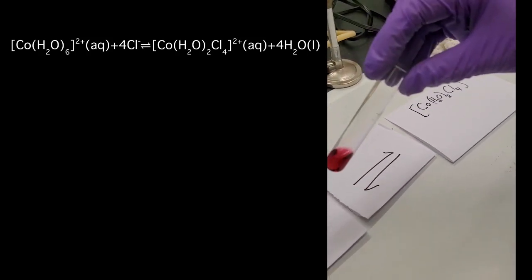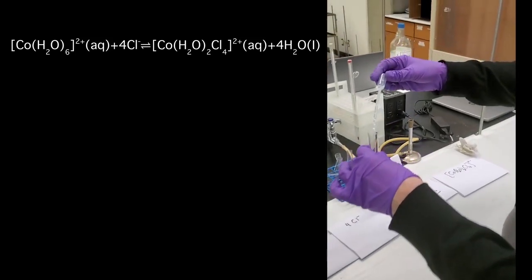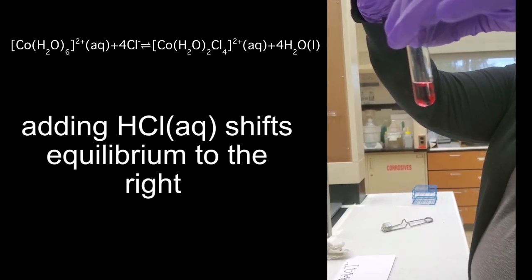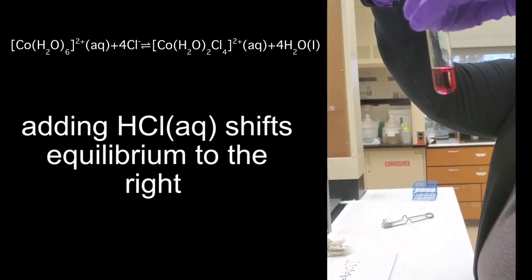The first thing I'm going to do is add extra chloride. Le Chatelier's Principle says if I add enough chloride, I should be shifting the equilibrium all the way over to the right, and then I can tell what color this one is. I'm going to do that by adding a little bit of hydrochloric acid — this is concentrated, so we're doing it a drop at a time. One, two, three, four, five, six, seven, eight.